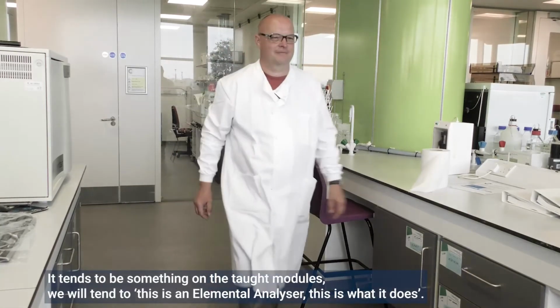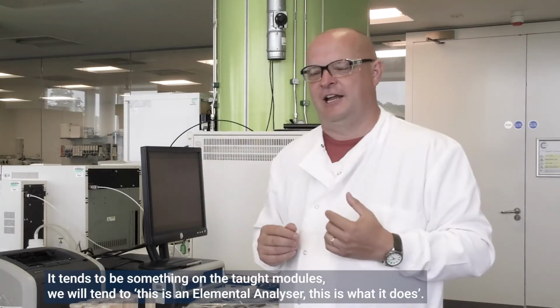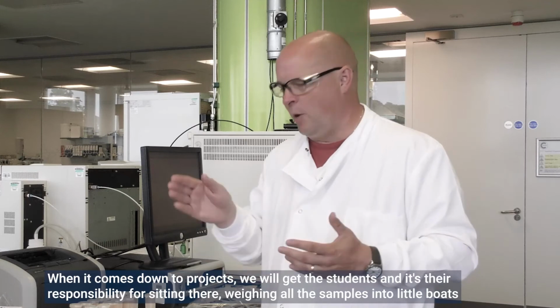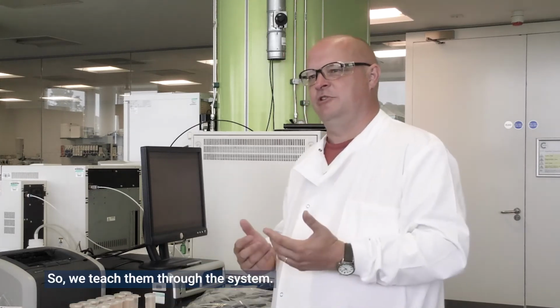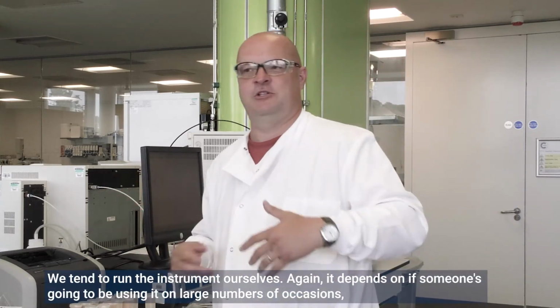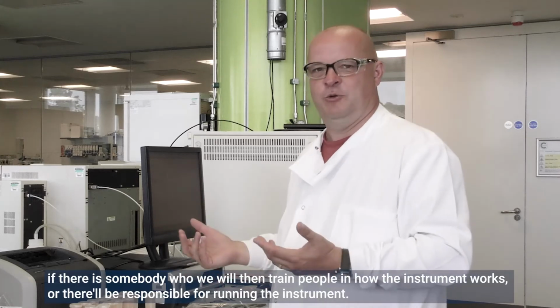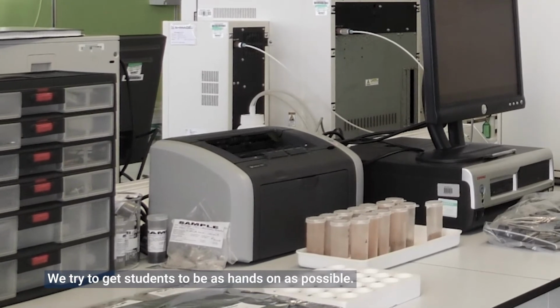It tends to be something on the taught modules: this is an elemental analyzer, this is what it does. When it comes down to projects, it's the students' responsibility to sit there weighing all the samples into little boats. So we teach them through the system. We tend to run the instrument ourselves. Again, it depends on if someone's going to be using it on large numbers of occasions. It's then with somebody who will train people in how the instrument works, and they'll be responsible for running the instrument. We try to get the students to be as hands-on as possible.